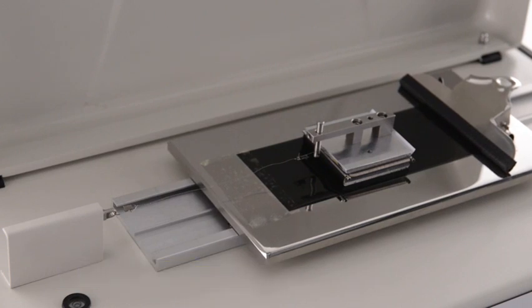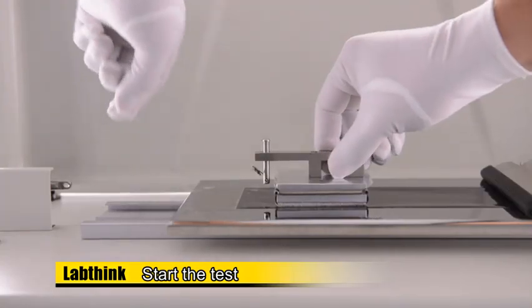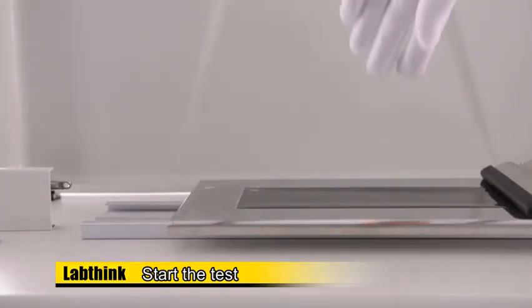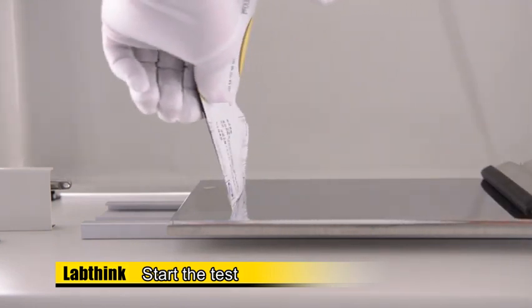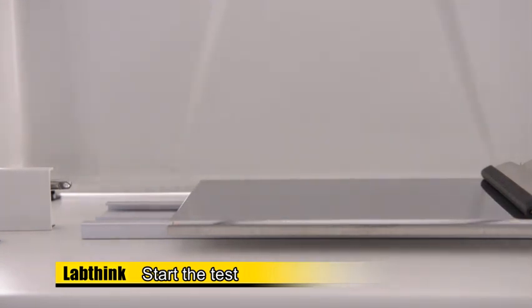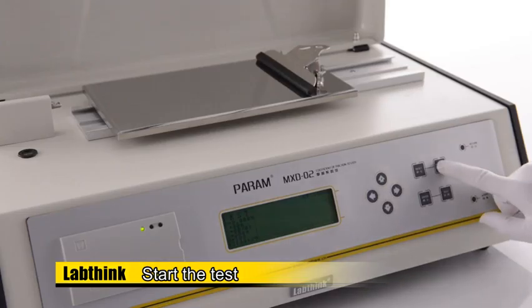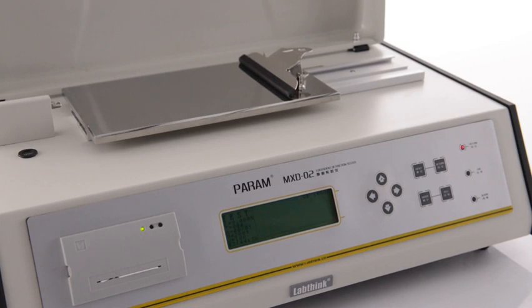When the test is finished, please remove the steel wire and the sled. Press Return so that the test platform will be returned to its original position, and when the indicator light on the right side of the instrument is on, it will stop.